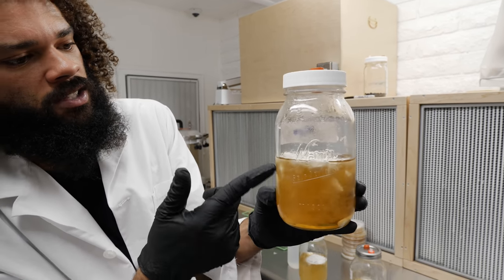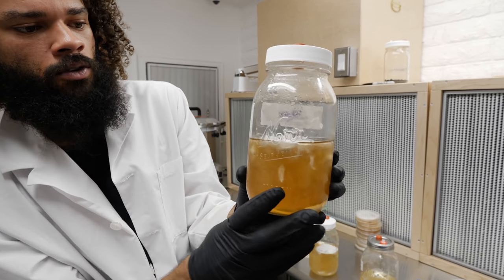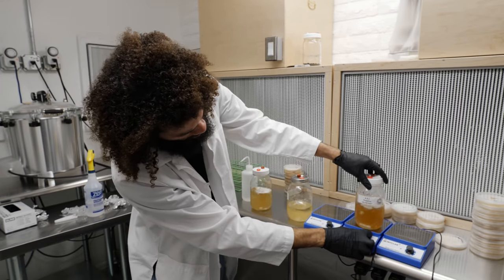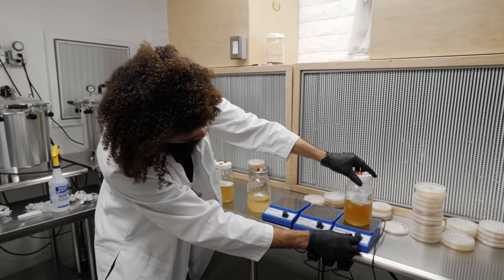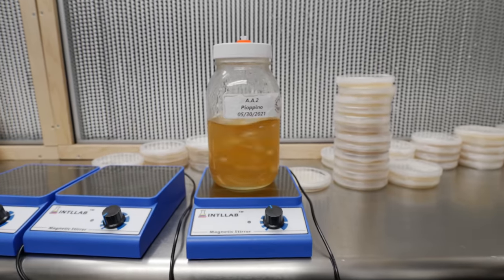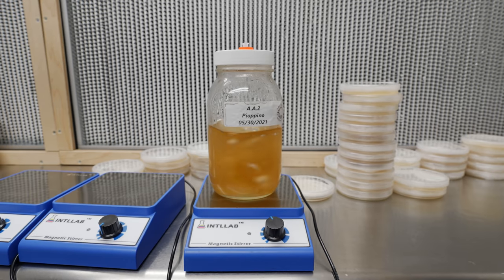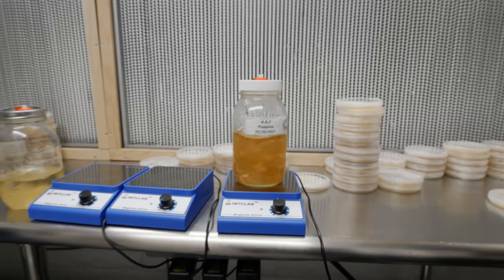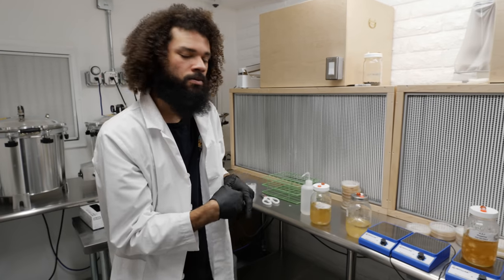This is a different liquid culture — a Pioppino one — and we can see it's fully colonized. A lot of times you'll start to see a mycelial mat develop on the surface of the liquid. This can just be re-agitated. If I were to use this right now, I would simply agitate the mycelium on a magnetic stir plate for about 30 seconds to a minute. The longer it goes, the more the mycelium breaks down, and from there it can be sucked right into syringes or you can even pour it directly into substrate or grain.